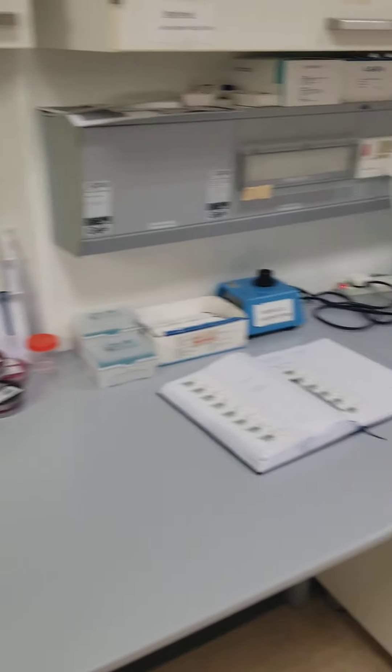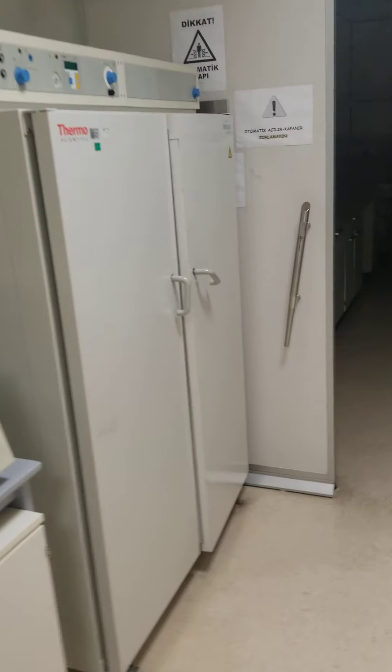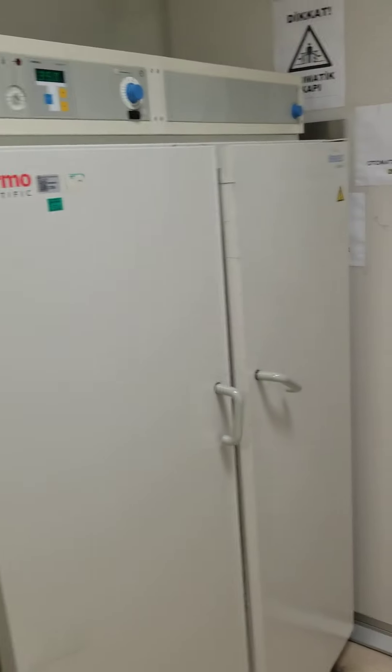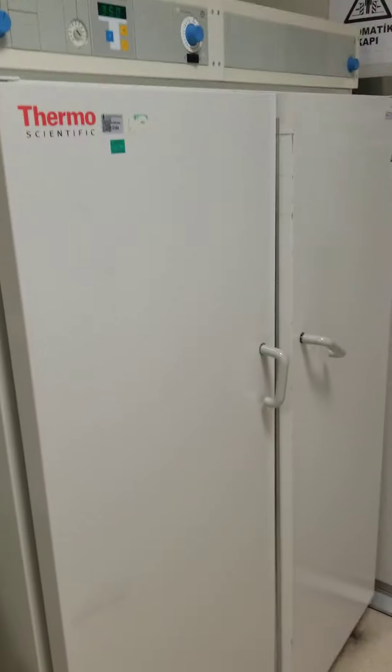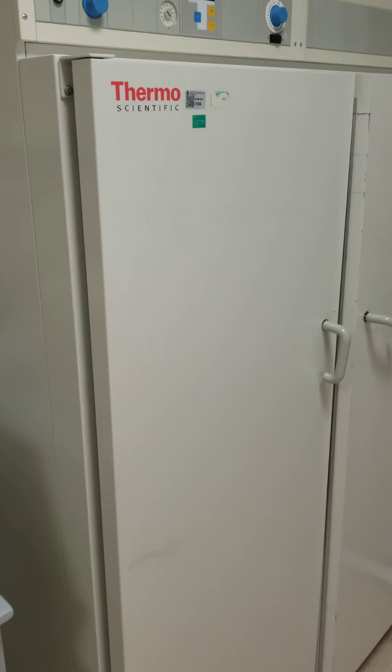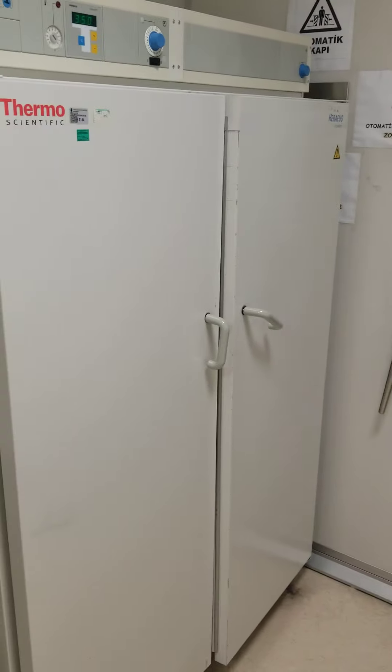This is another incubator where we keep all the plates that we are doing the quadrant culture for both urine and blood, using the EMB agar and the blood agar.